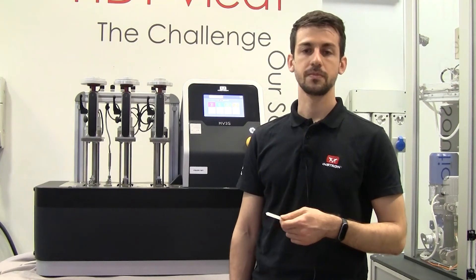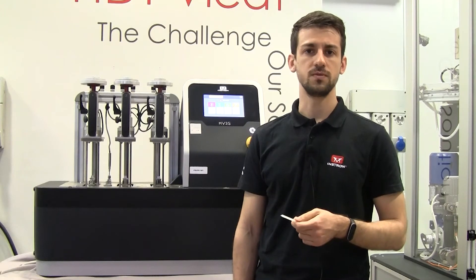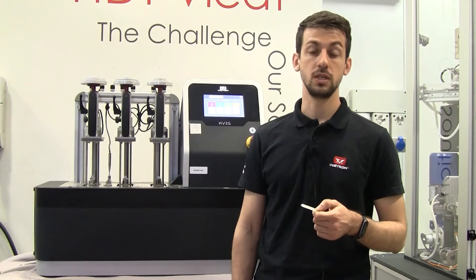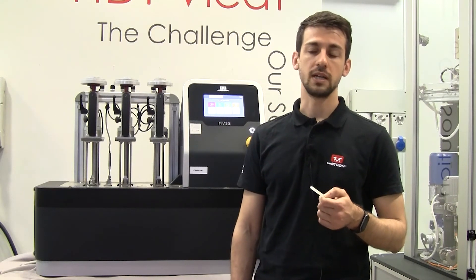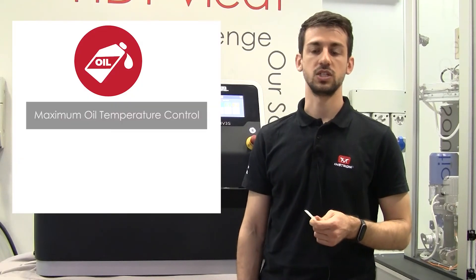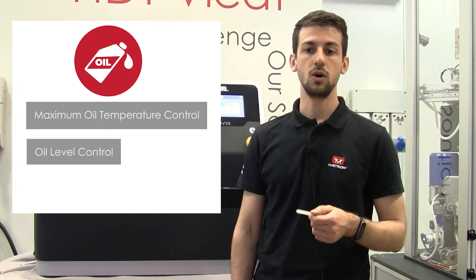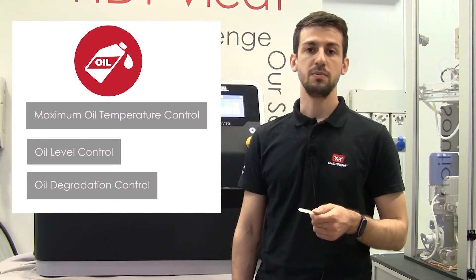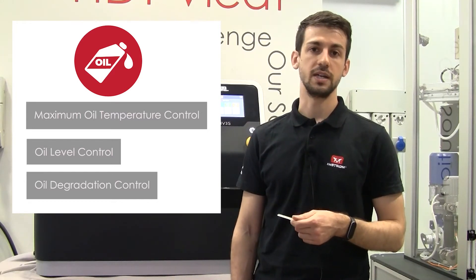For my test I'm going to use an HV3S machine that is equipped with three stations. This machine can contain up to 12 liters of silicone oil, and for my test I have filled it with medium temperature silicone oil as I expect to reach up to 140 degrees C. Innovative features such as the maximum oil temperature control, the oil level control, and oil degradation control monitor the oil throughout the test, helping me reduce the risk of running invalid tests.